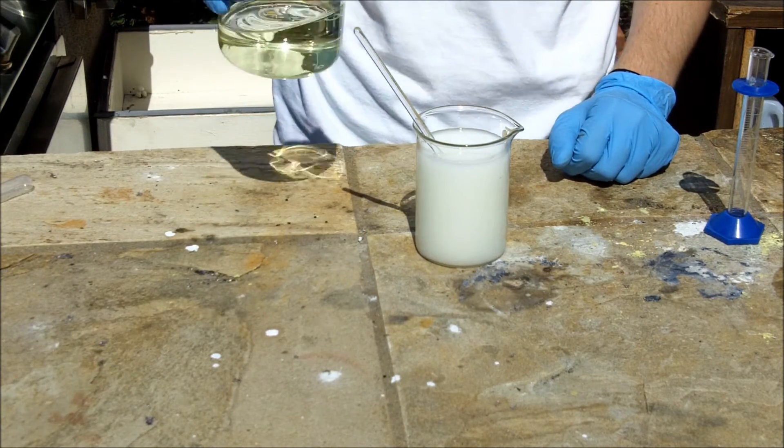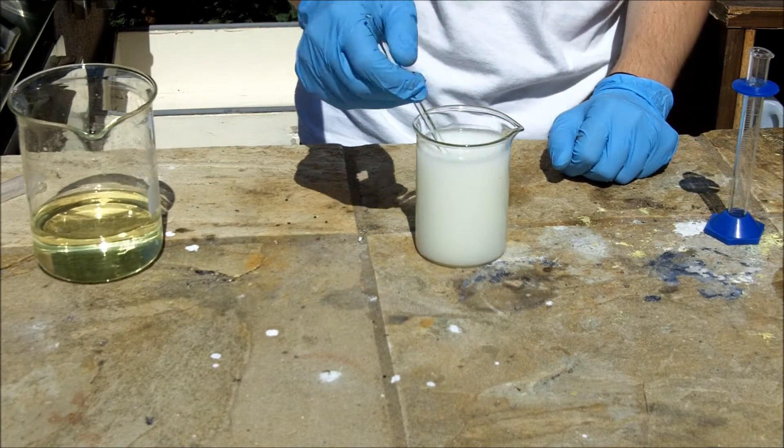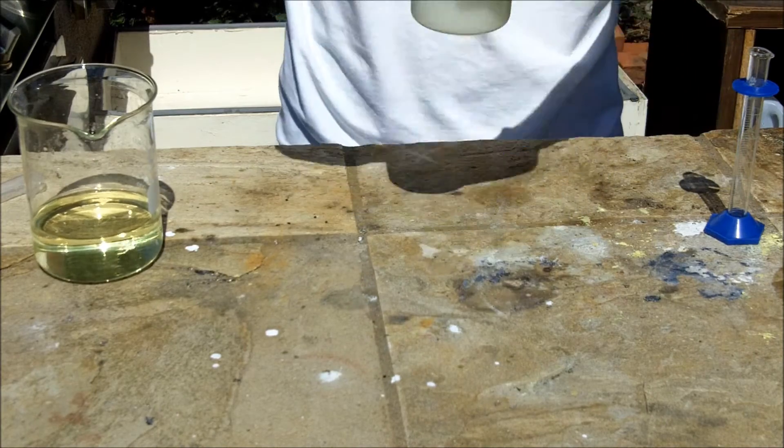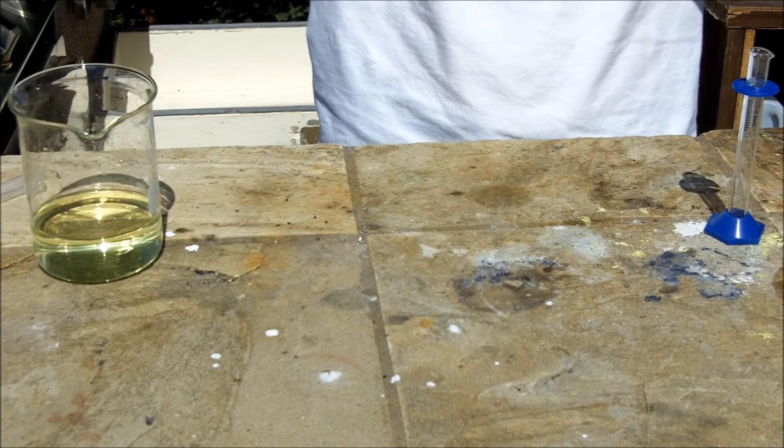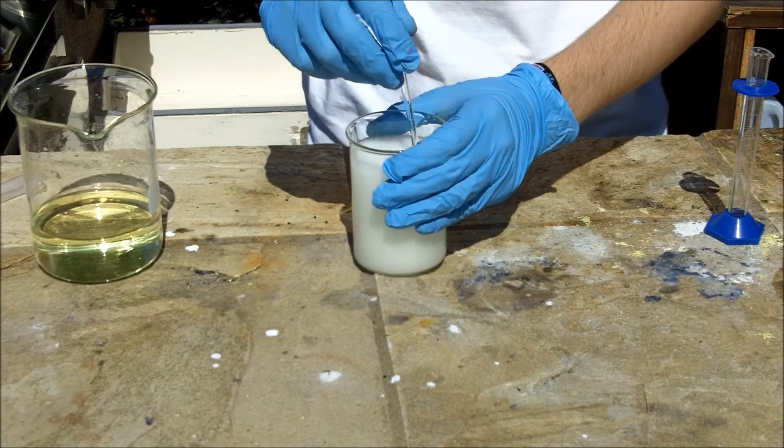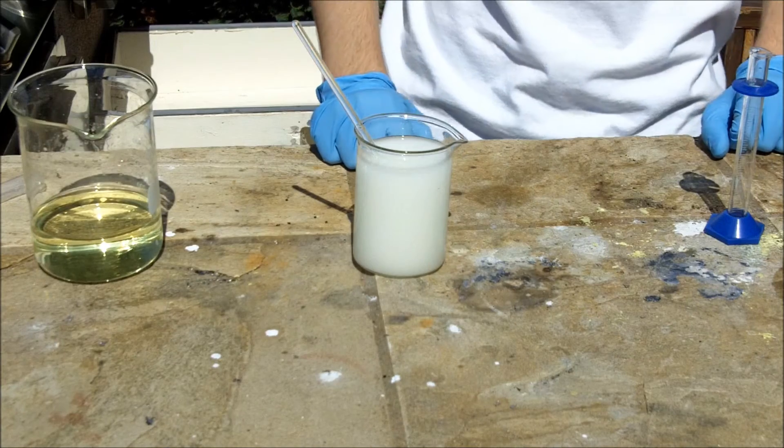Bromoform is a very dense liquid, so we should see a phase level separation. All right, now that I've got this cloudy solution, I'm going to let it sit to let the bromoform settle down.